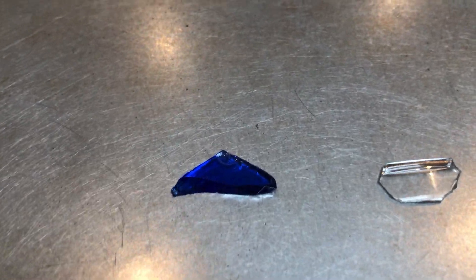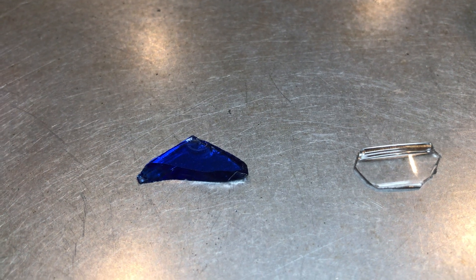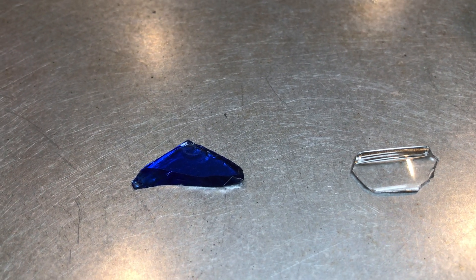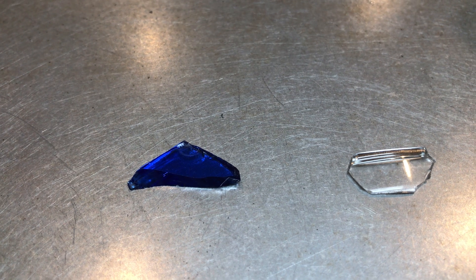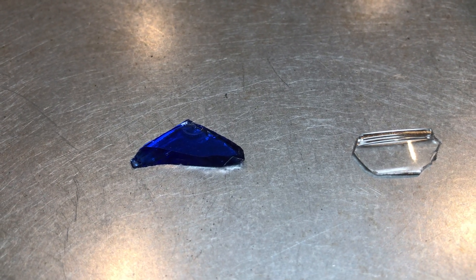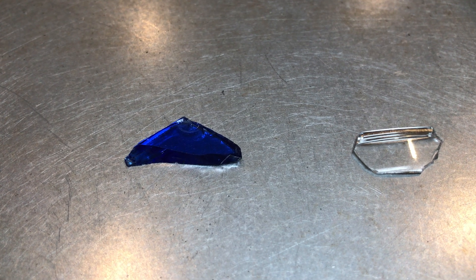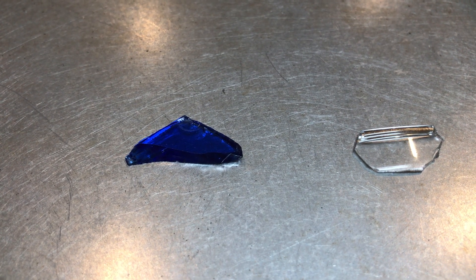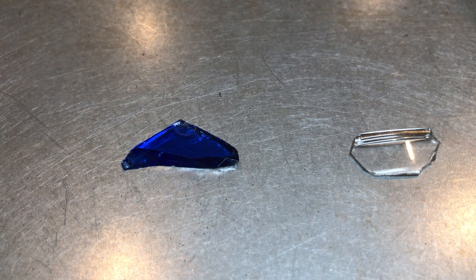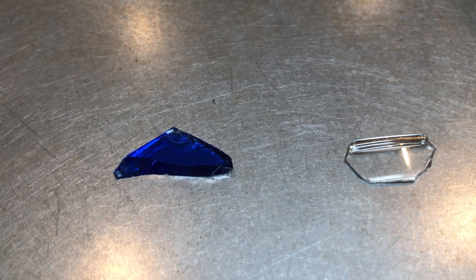As part of this process we're also going to take a look at what are called markings and fine details. Markings are things that were put in the glass specifically by the manufacturer — things like lettering, numbers, specific textures that can be put into glass for grip or for beauty, designs, things like that.